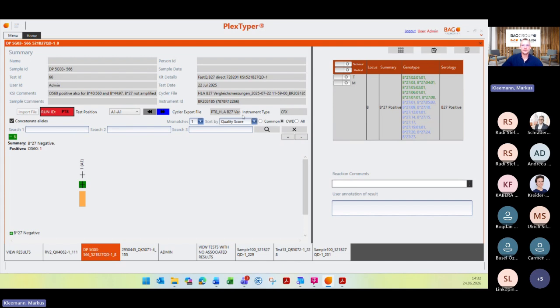And what you also have here for B27, CD, and also Rainbow is this mismatch area, where you can annotate your results. If you see that you got no results for one target, for example, that you have to recheck one of the reactions, which is maybe too low or which has a warning, then you can switch these mismatches from 0 to 1, for example, to see if you can annotate one of the reactions or not. If the problem is the sample or not, if you have to repeat this test, this is also a good tool here in PlexTyper to annotate your mismatches.